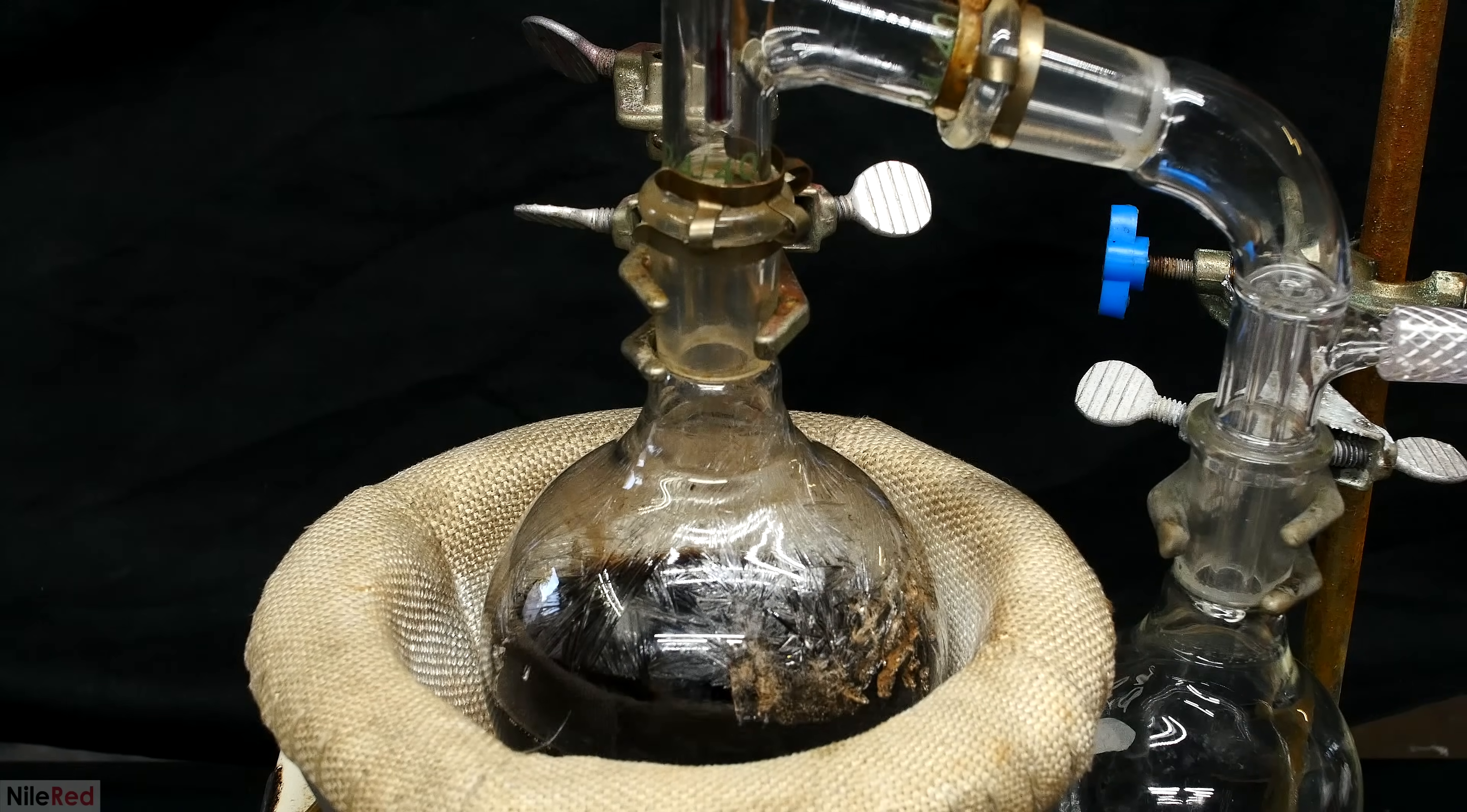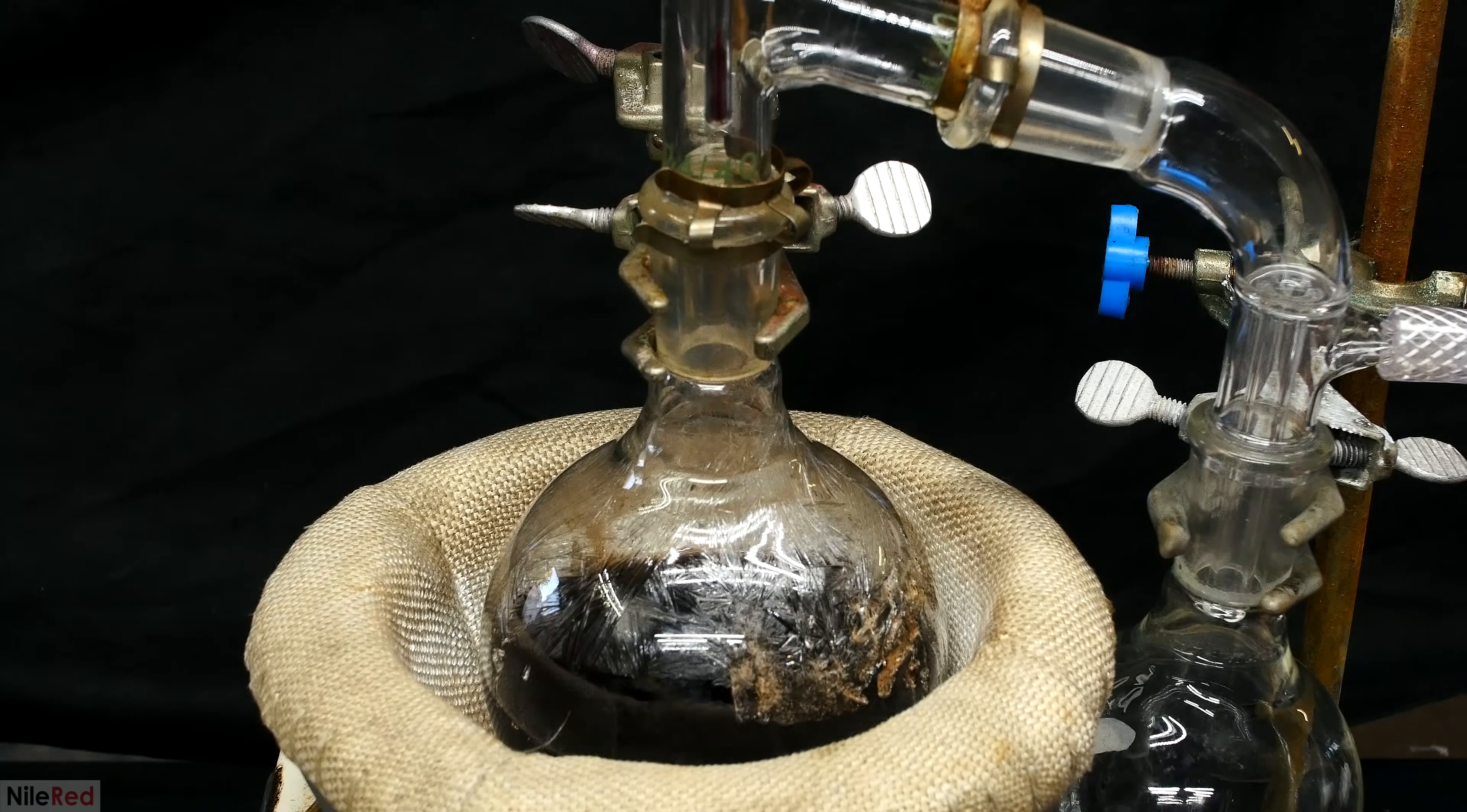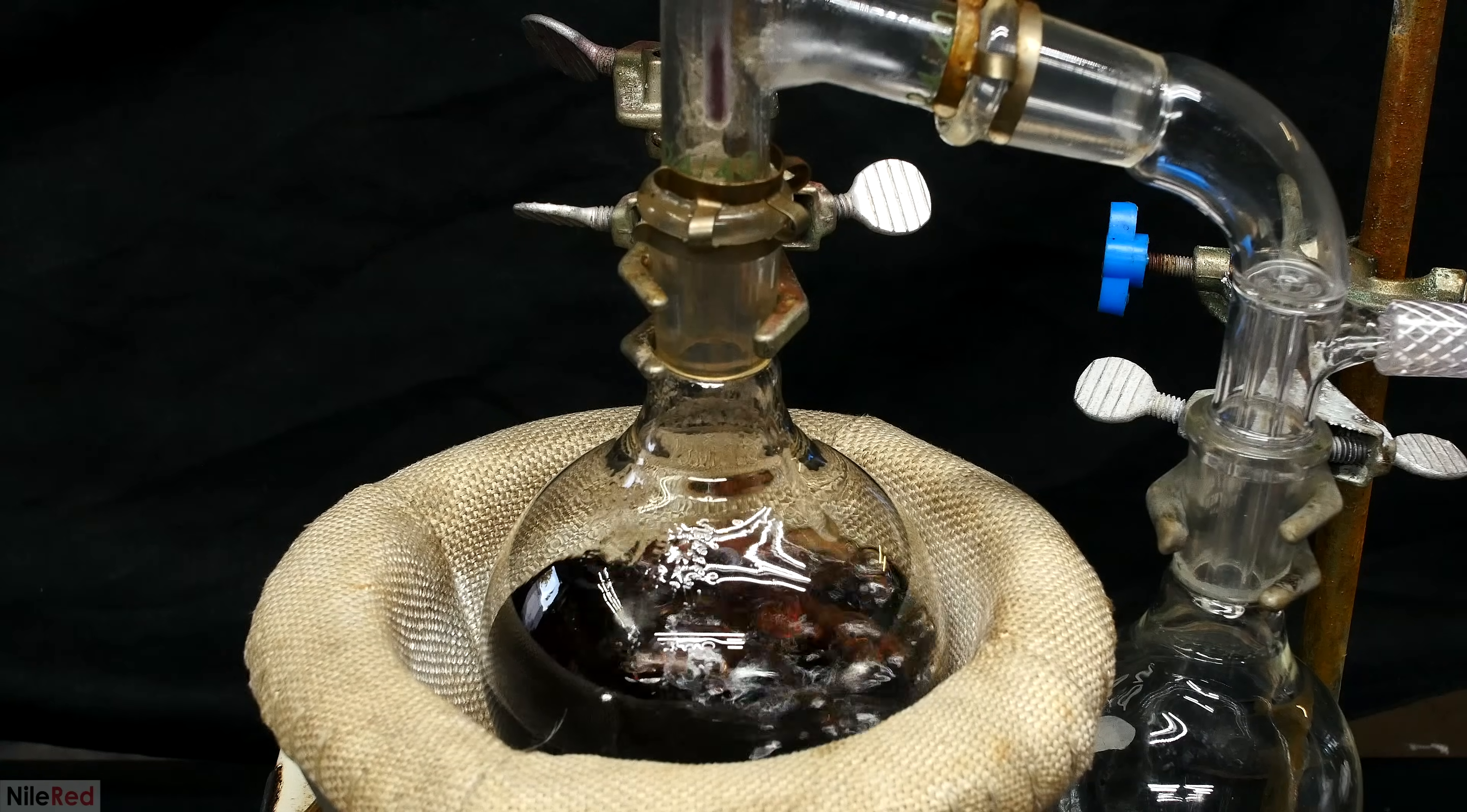Once under vacuum, I turn on the heating mantle and the stirring, and we can get the distillation started. It doesn't take long before it's boiling quite nicely, and we start to get some stuff passing over.